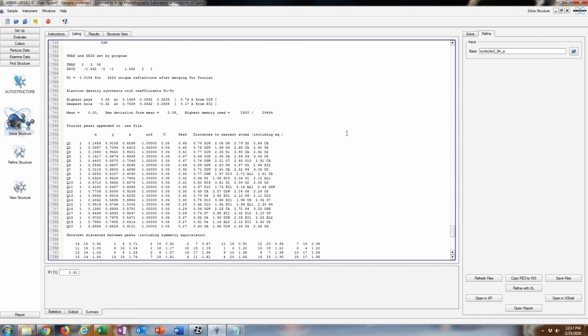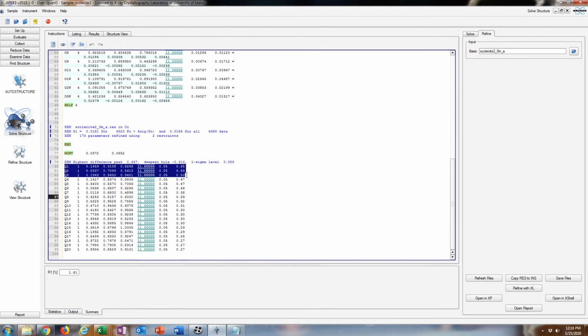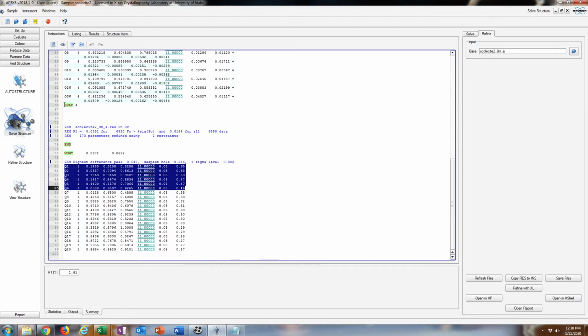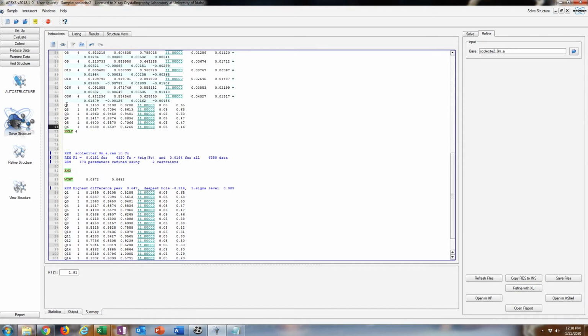And we can check the bond lengths from these Q peaks. So right here it says distance. That's a bit short for being a water molecule, but that's probably correct. So O1W, O2W, those have got to be hydrogens that go along with our water molecules. Alright, so we're going to go back to the instruction file. And I'm just going to copy these and paste these on. And I'm going to rename them H1 and so on.